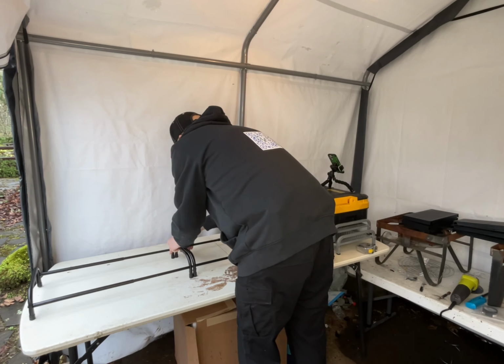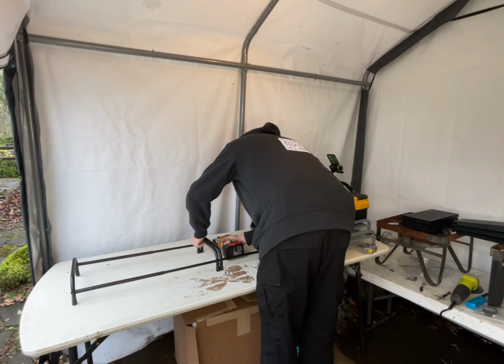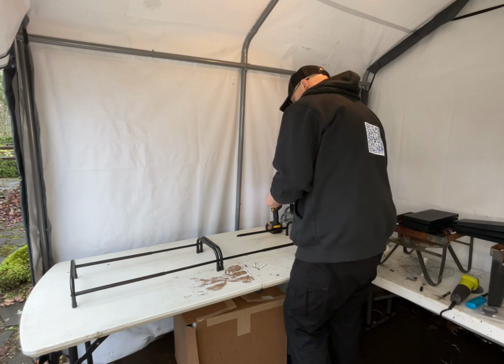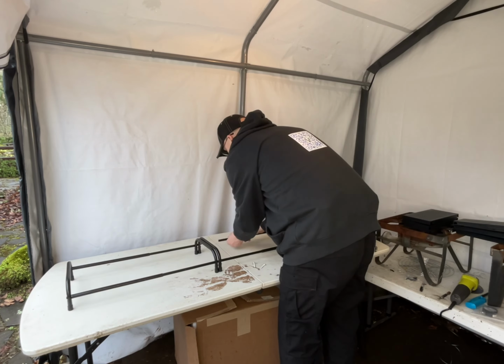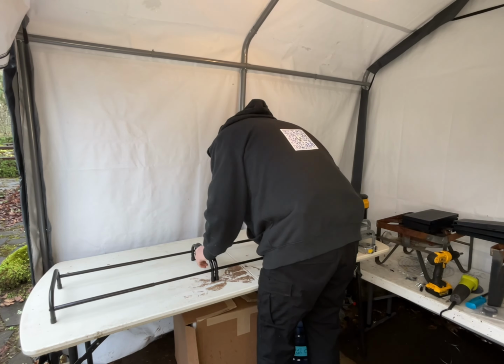Anyhow, so we're going to get these two lined up, get them measured out. Make sure when you're doing this to be real careful with the height of it moving. When I drilled mine, they tried to move up on me. I had to readjust them here.